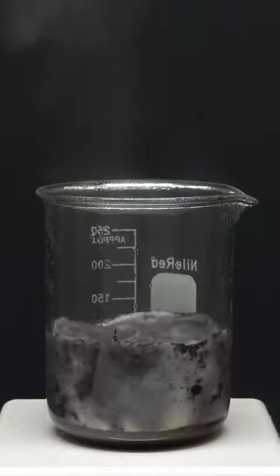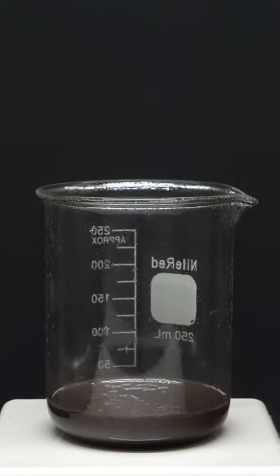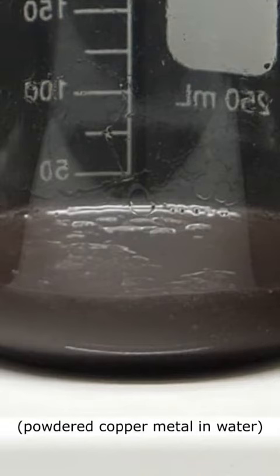It unfortunately didn't last too long, because all the aluminum quickly got shredded. What I think is cool, though, is that when it's done, all the aluminum is gone, and I instead have a bunch of copper metal.